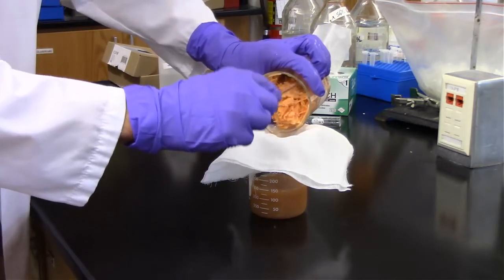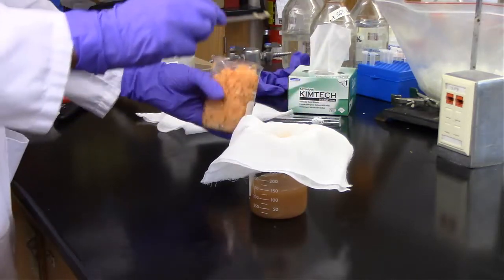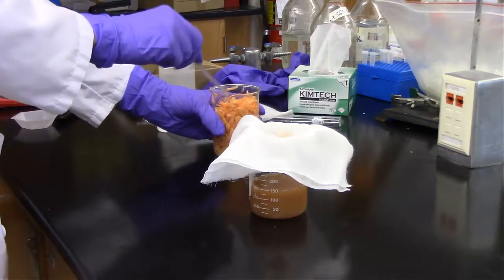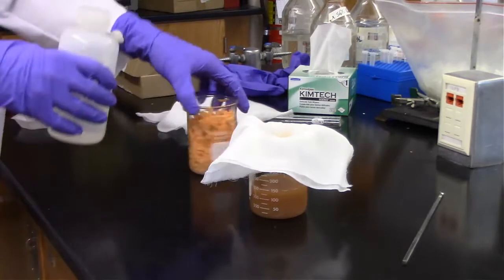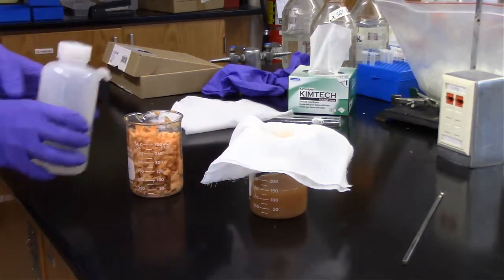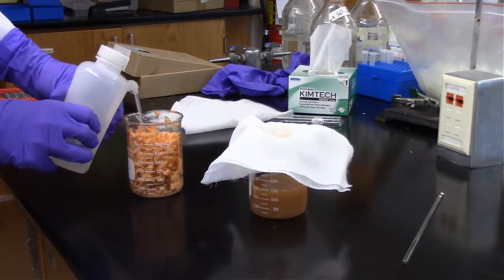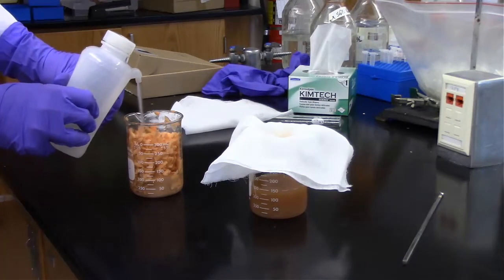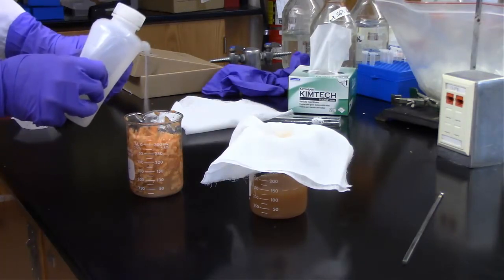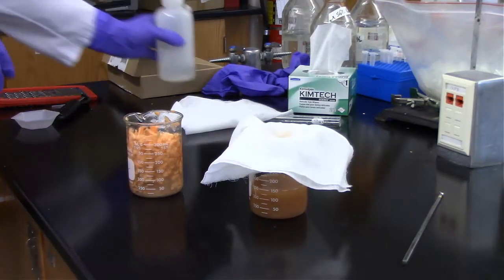So we do expect our starch to run through that cheesecloth. Even though it's still floating in water, it's not soluble in water, it still isn't going to be caught by that non-fine filter paper or cheesecloth, more appropriately said.